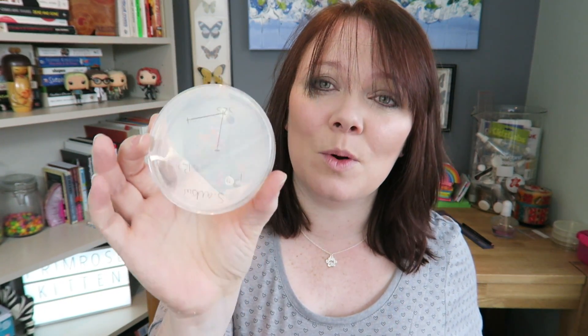For this video I used antibiotic discs, but you can make your own discs. All you need is a hole punch and some filter paper — punch out little discs about this size, then soak them in something and leave them to dry. So like bleach, toilet cleaner, vinegar, anything you could find that you can use in the classroom. Pop those onto your plates and then see what the clear zones look like. This is just another way of doing the experiment.